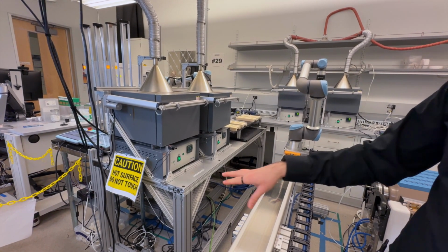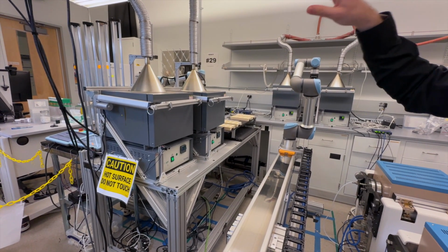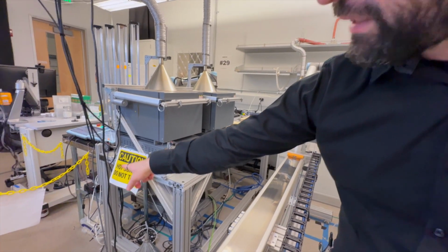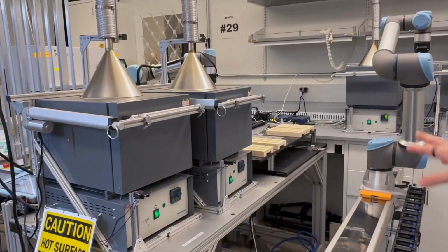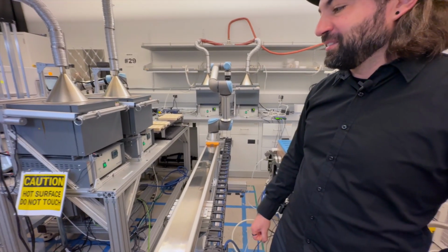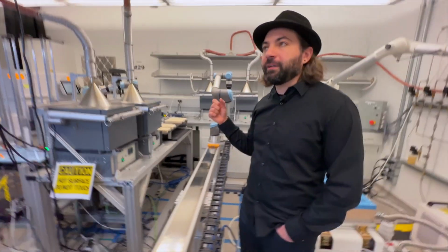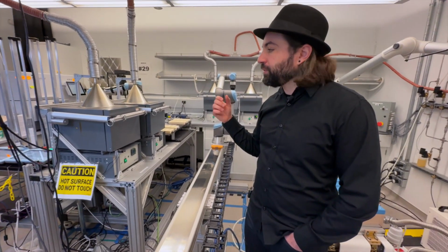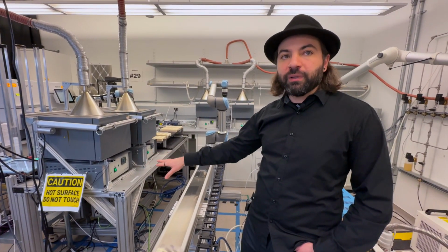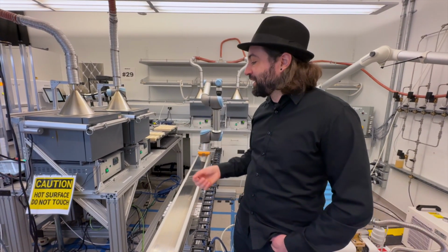And yeah, then we have this aluminum extruded structure to just go around. So it's a very cheap structure. Then we have the controller there, the black boxes. That's each box control, 2 of them, and it's been working since the very beginning. So it never failed. We are aiming, now with the expansion of the lab, to have more of the electronics on PLCs, and this one is still on an Arduino. But for 3 years, 2.5, let's say, everything is working really well.